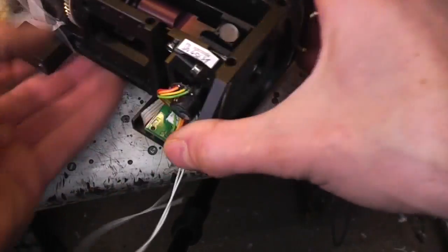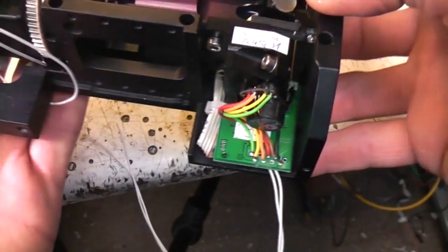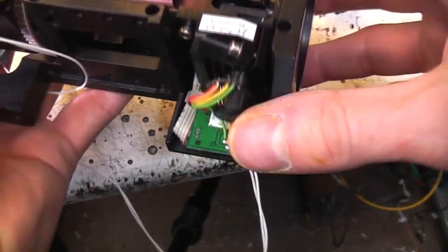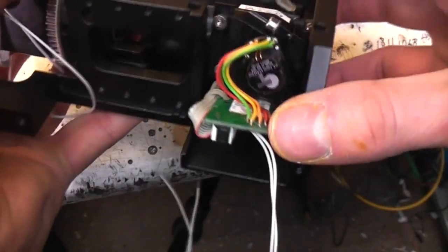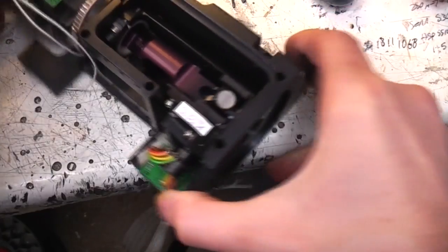I don't think there's much going on, but obviously I'm not going to take these galvos apart because these are quite useful things. I'm going to leave this assembly as it is for the moment because it might be easier to line up if you want to try messing around with this in conjunction with the acousto-optical bits. So I'm going to leave this as a single assembly for the moment.